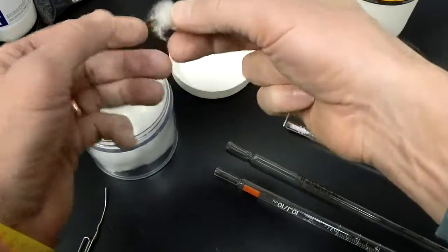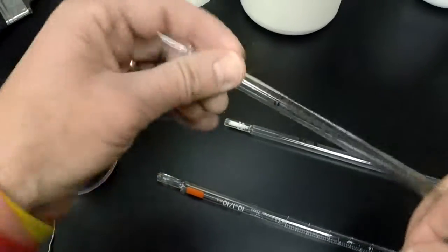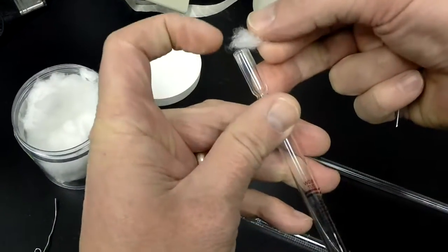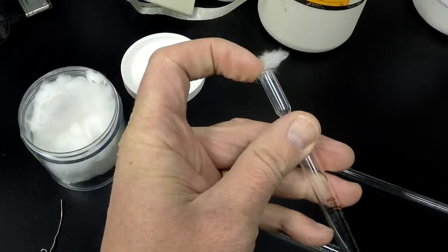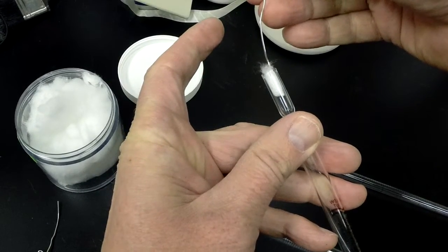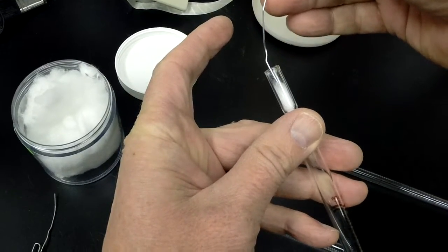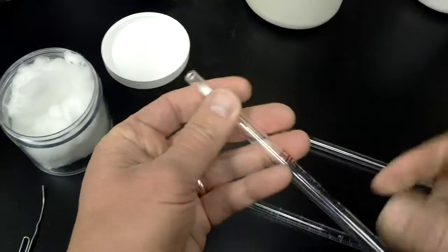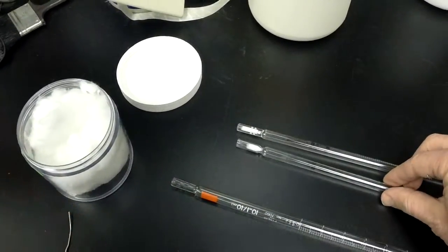So once again, you just simply pull the pieces of cotton the size you want to work with, place it on top, put that on top here. Use that to literally drag that down inside to the actual restriction and tuck it. That's the procedure.